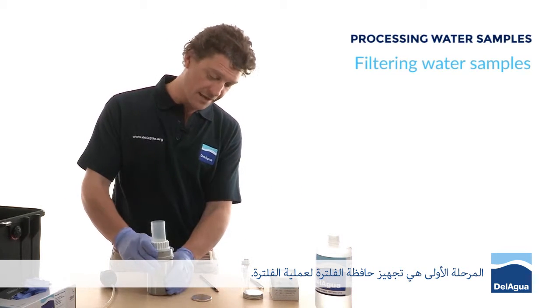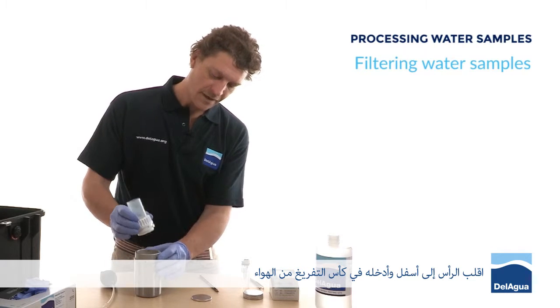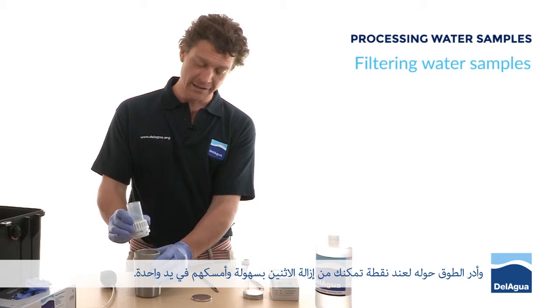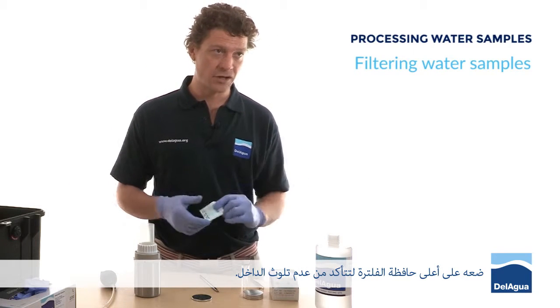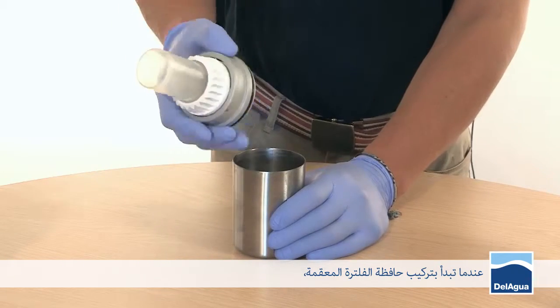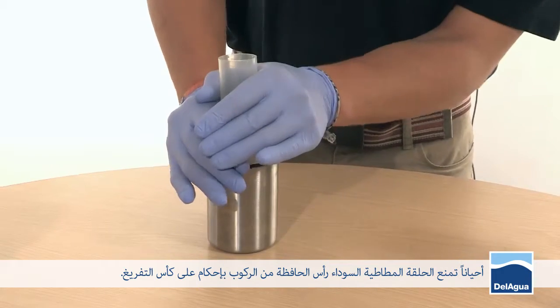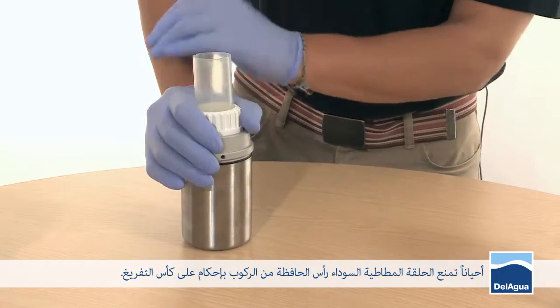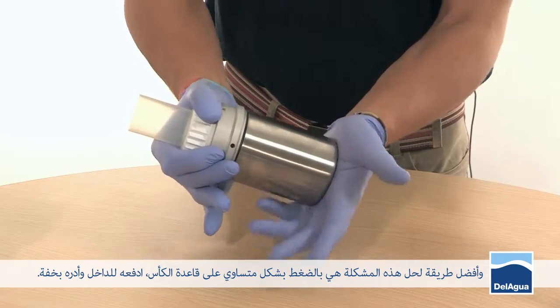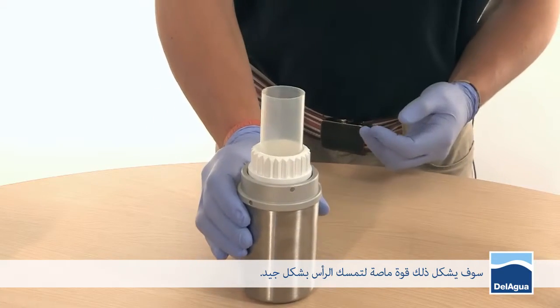The first stage is to get the filtration manifold set for filtration. Turn the head upside down and insert it onto the vacuum cup, then turn the cuff around to the point where you can easily remove the two and hold them in one hand. Replace it on top of the filtration manifold to ensure the inside doesn't become contaminated. On occasions, the black rubber o-ring prevents the manifold head from sitting into the vacuum cup — a good way to alleviate that is to press evenly across the base, push it on, and turn it slightly to create enough suction to hold the head on.